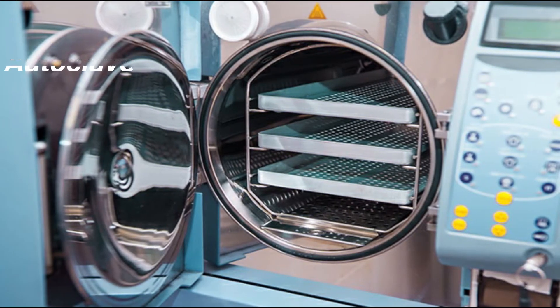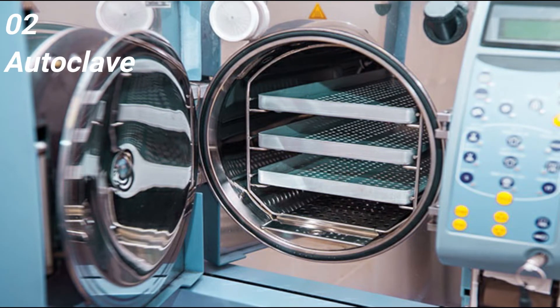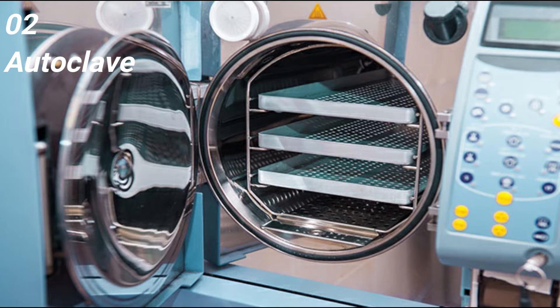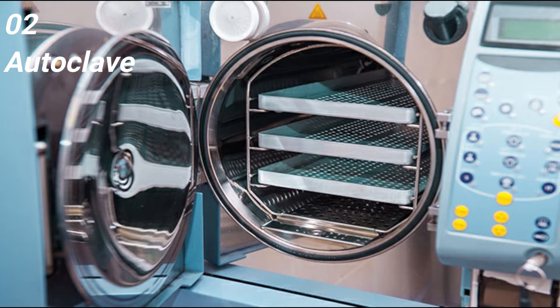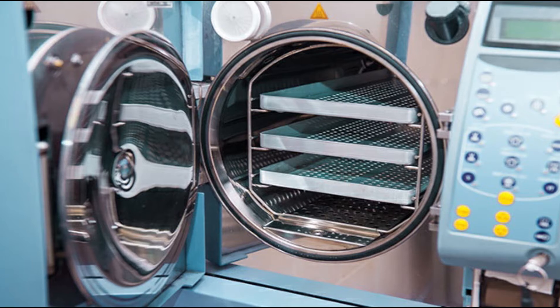On number 2, I would like to tell you about autoclave. An autoclave is a pressurized chamber used for the process of sterilization and disinfection by combining three factors: time, pressure, and steam. Autoclaves are mostly used for the sterilization of medical or laboratory equipment with the capacity of sterilizing a large number of materials at once. They are commonly used for the preparation of culture media during laboratory applications.